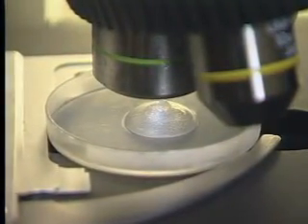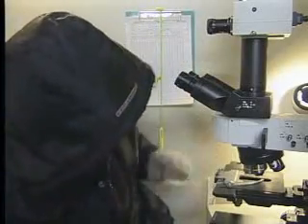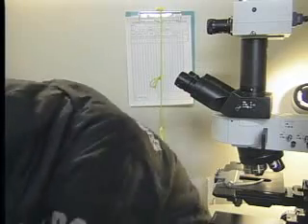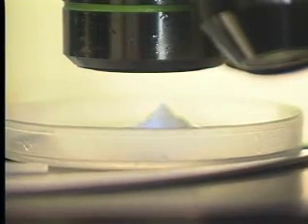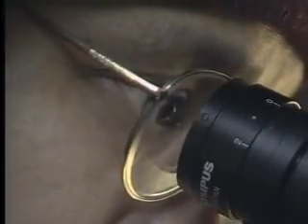The crystals start to grow and expand as the temperature of the ice tip rises under the microscope. Usually, however, of the 50 ice blocks that we have to work with, only a few reveal their beautiful hexagonal crystals on camera. What kind of crystal will the water from Shiraito no Taki Falls show us?